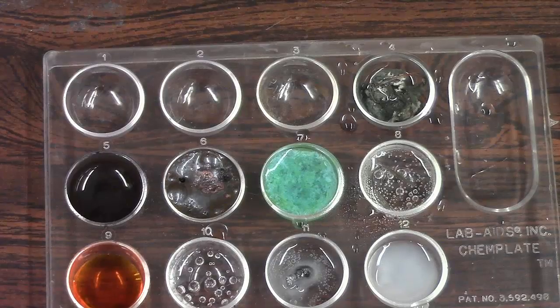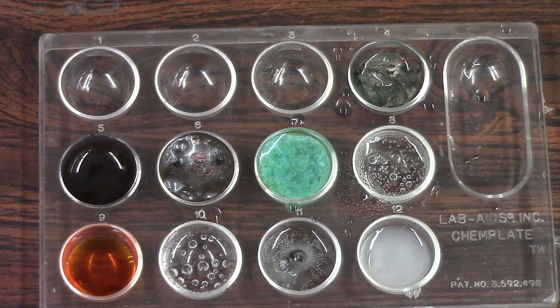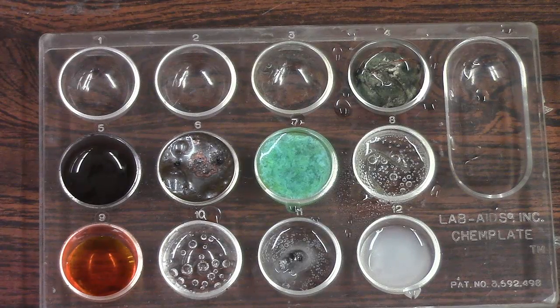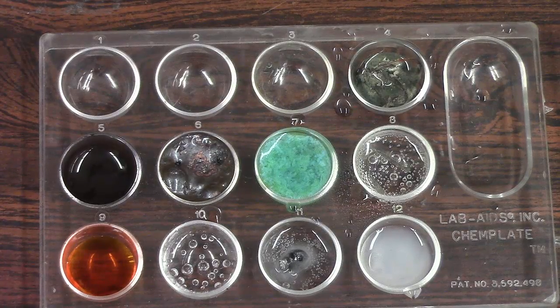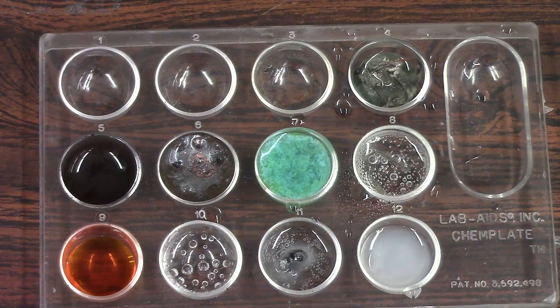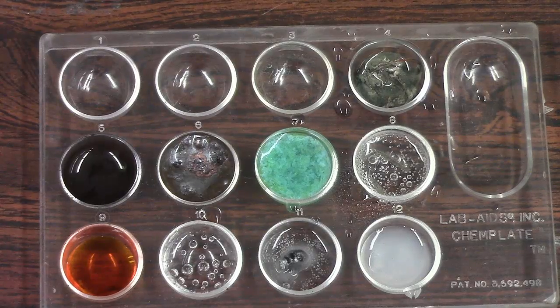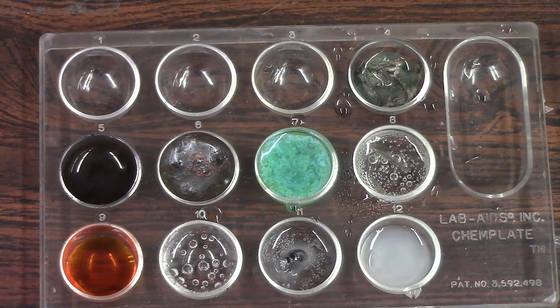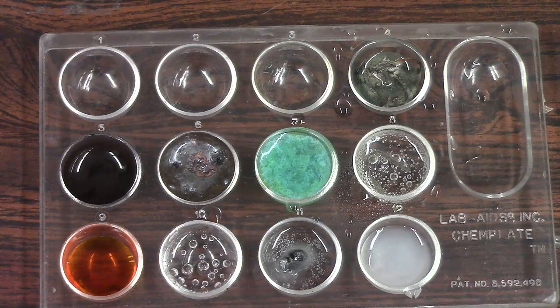So there you have it. You can see that this is a pretty informative and nice visual experience when it comes to chemical reactions—the different types of chemical reactions. The goal of this was to give you more insight into exactly how double displacement, single displacement, synthesis, and decomposition behave and how they look.